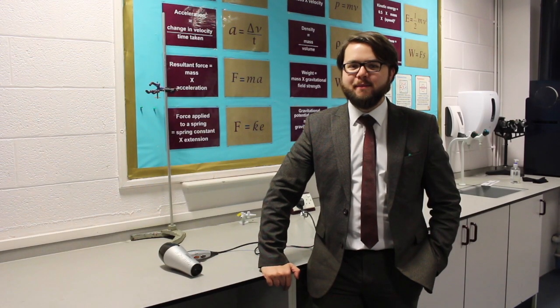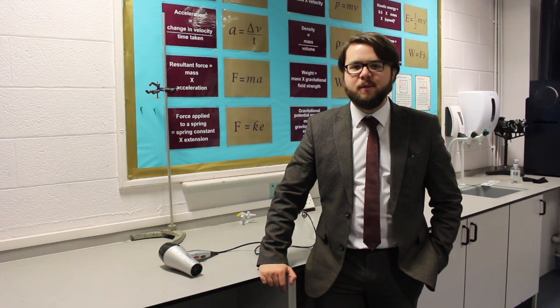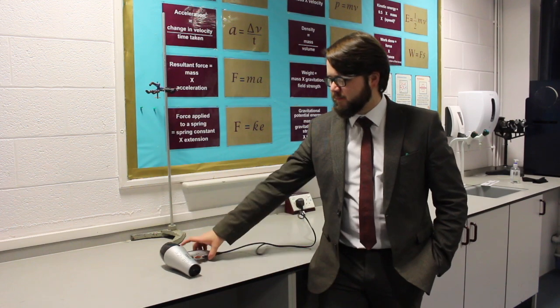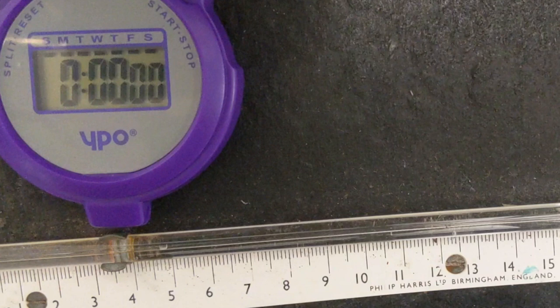I'm now going to change the environmental conditions a second time using this hairdryer. The increased airflow will mean that the water that leaves the plant through transpiration will be removed, and this will maintain a steep concentration gradient between the inside of the leaf and the environment. Final experiment, we used a hairdryer to increase airflow around the plant. This would be like a windy day for the plant. This time, the starting point of the bubble was 47mm along the ruler. Let's look at our final time lapse to see what happened.